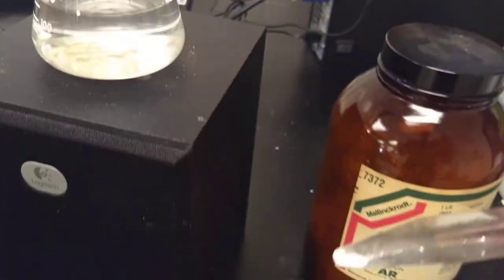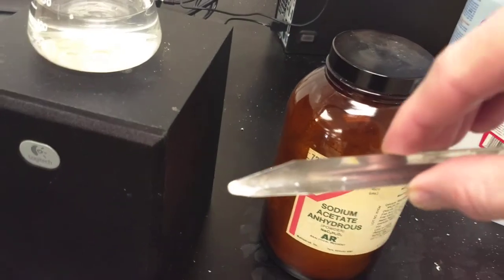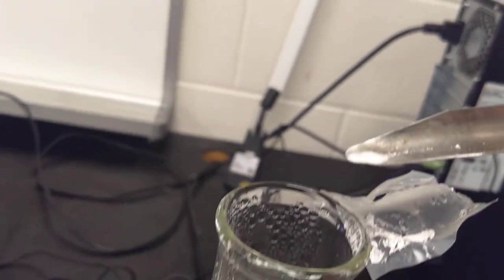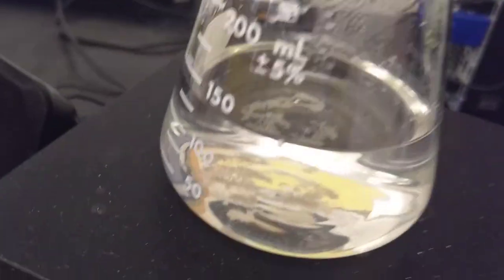And just by dropping in a little bit of the sodium acetate, you'll see that it should crystallize as soon as I drop in just a tiny little bit.